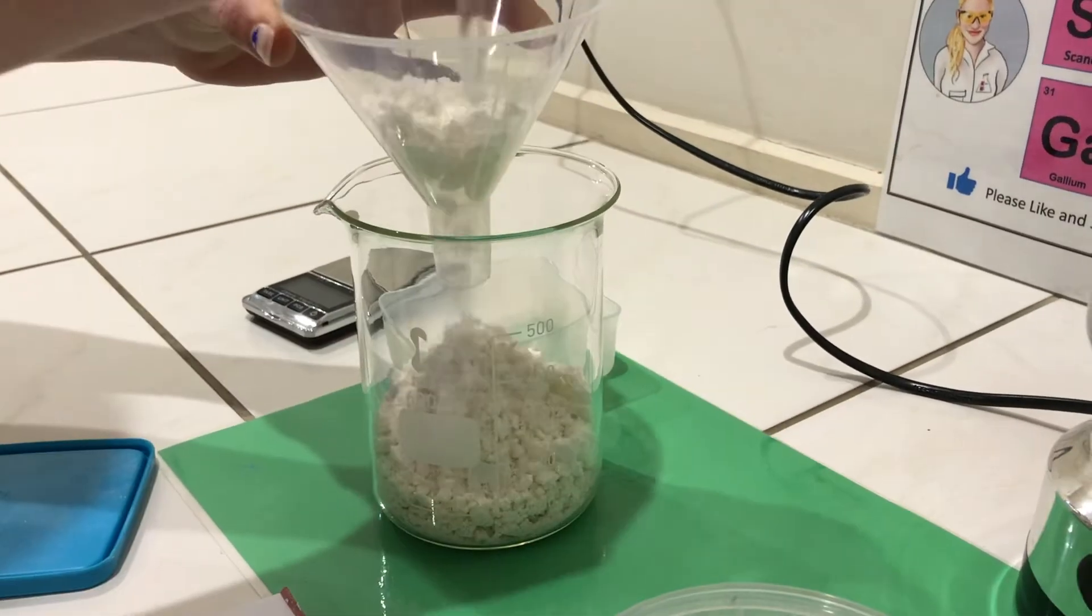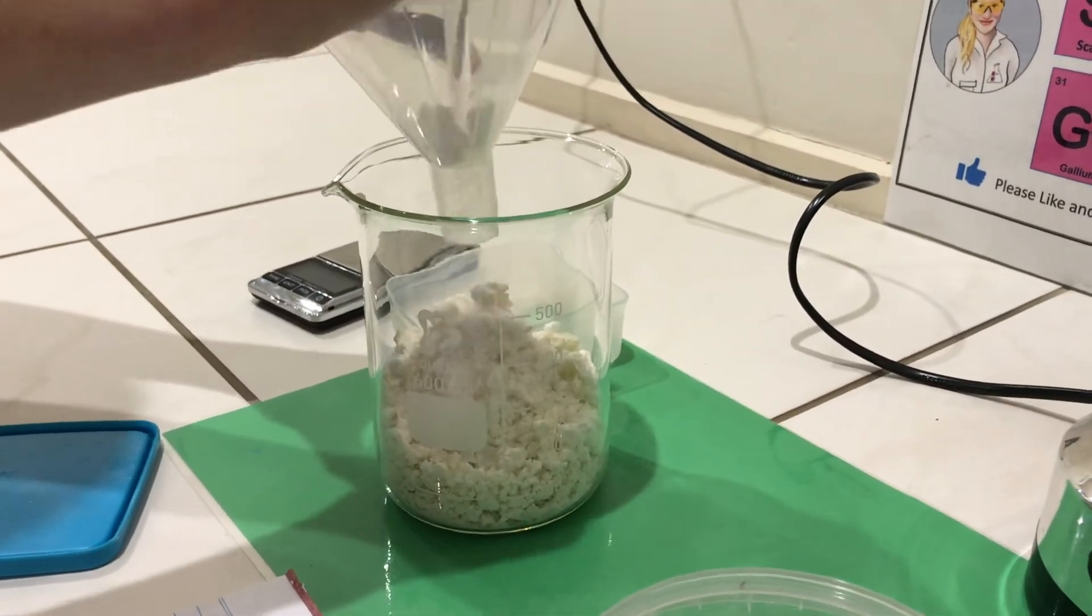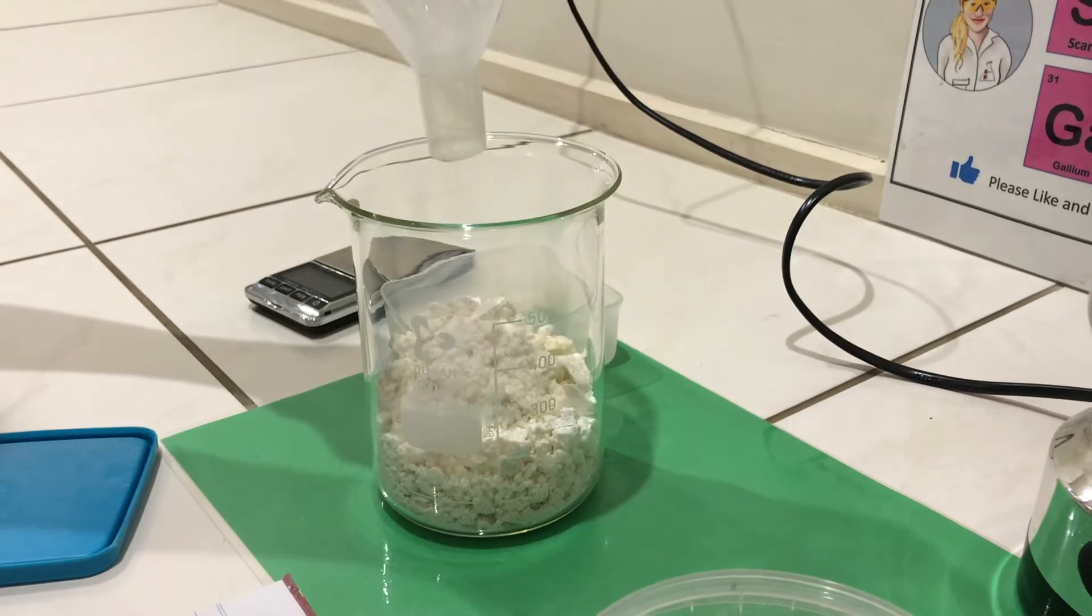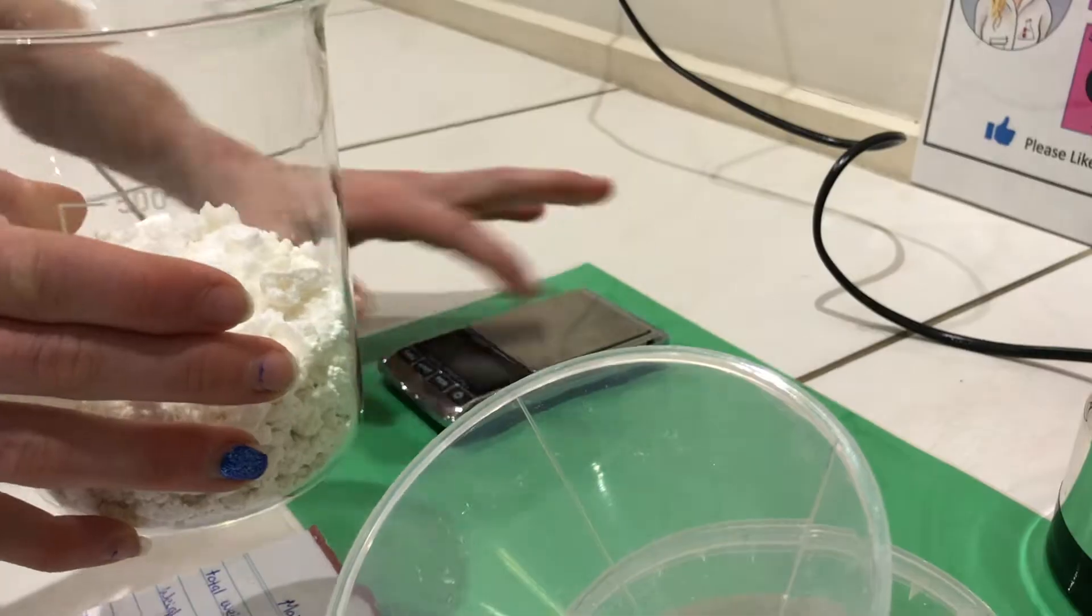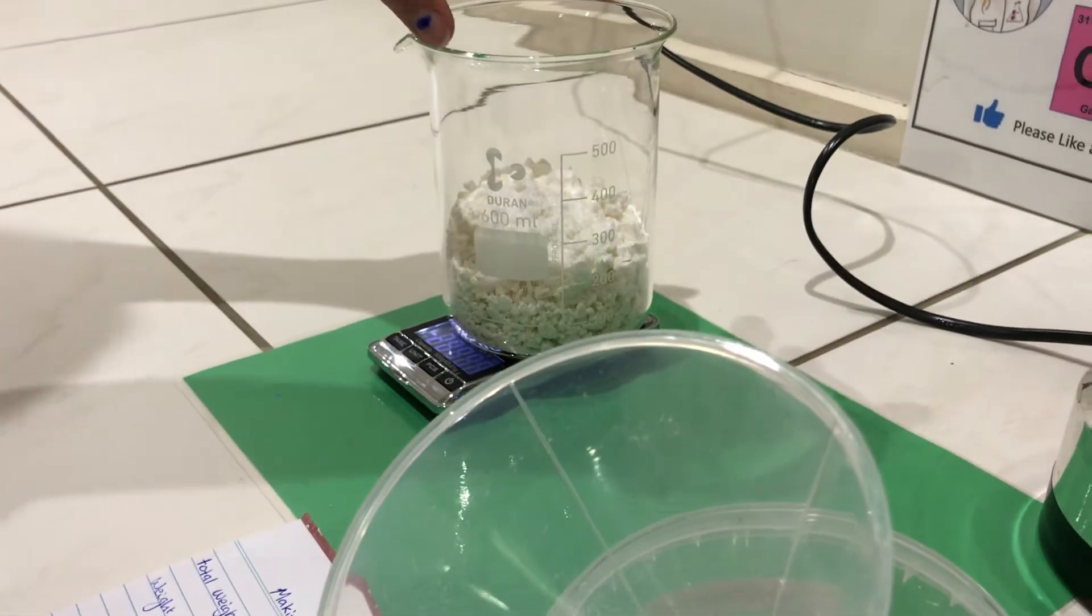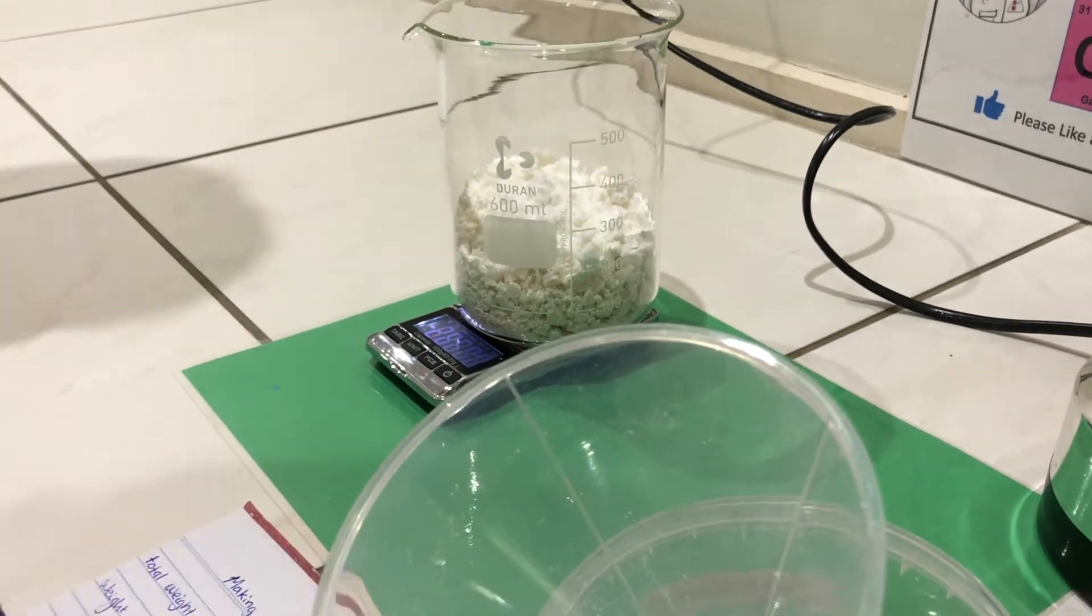As said previously, this is the calcium acetate I made in my first video. If you haven't seen that video, make sure you check it out. I'll have that video, as well as my other ones, where I have made calcium hydroxide and flaming jelly in my description below.